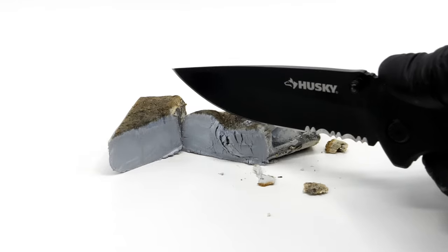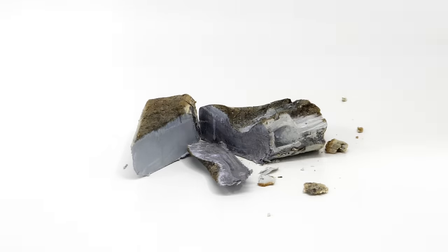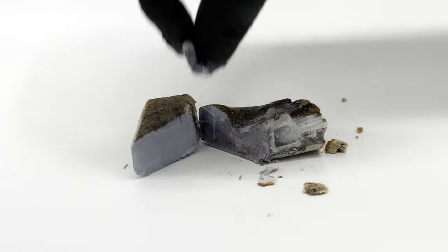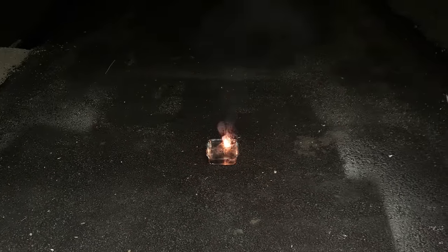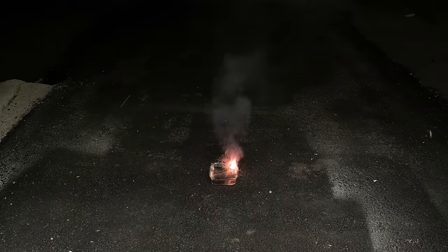Now, just for fun, I chopped off a thin slice of it, and I dropped it into some water.